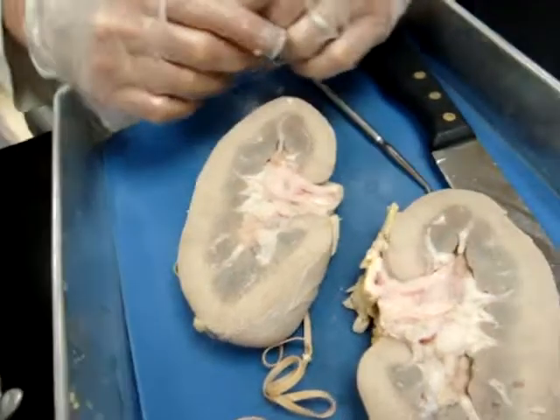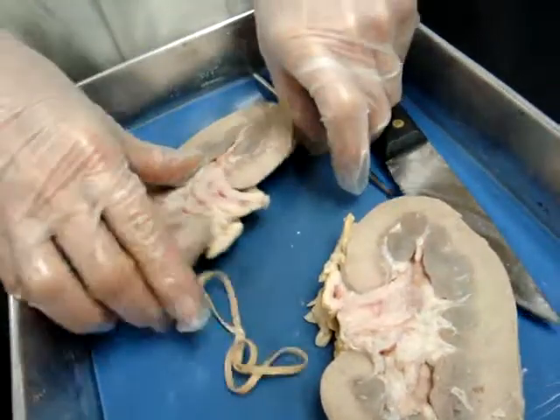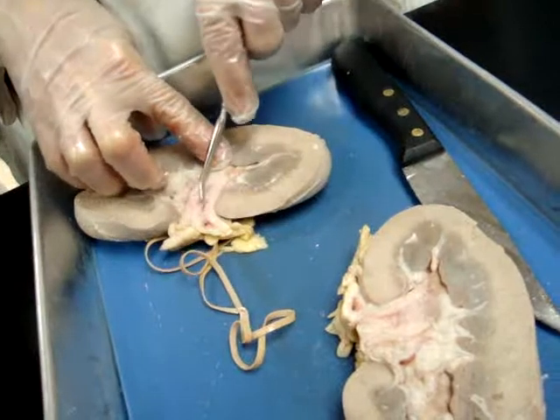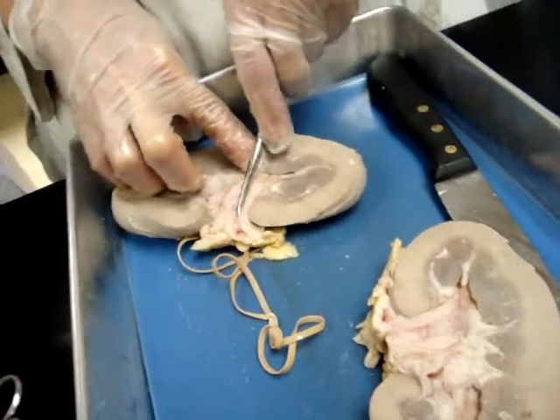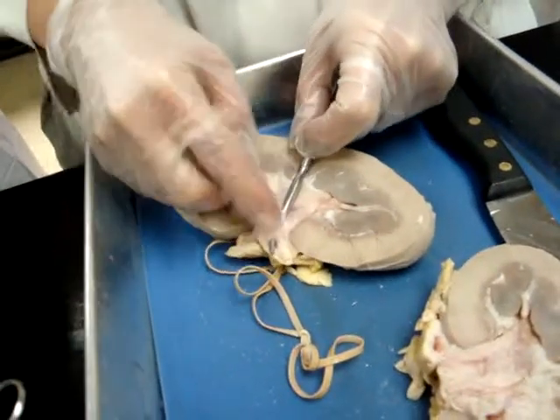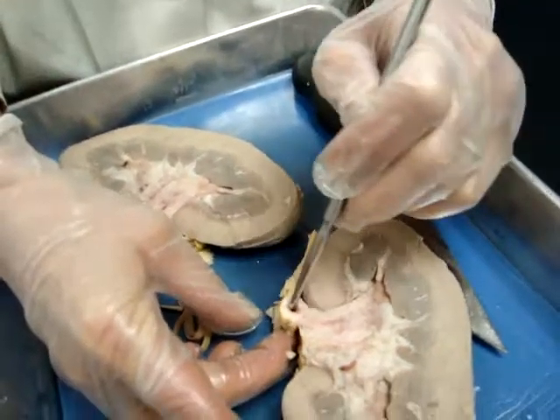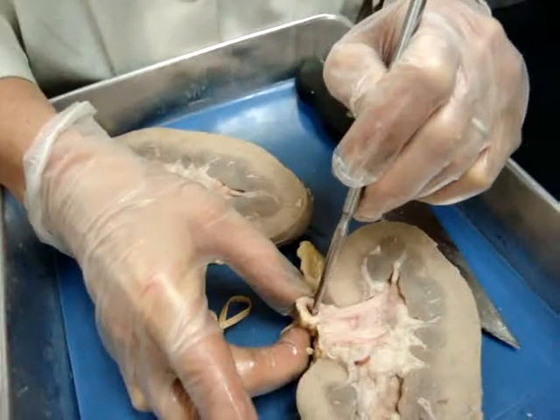Now, where did you say the ureter was? The ureter on this one — see if I follow out here. Here's the pelvis here. If I follow out, there's the ureter, this part here. So you can also see it here.